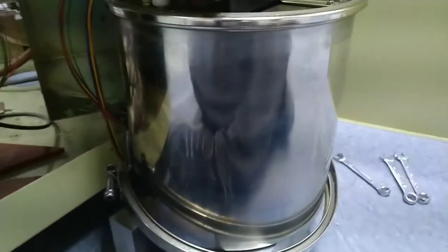By the weight of it, there's a very sizable coil in there, so I am going to try and reuse all that stuff. As far as I can tell, the circuit board looks okay — not any major burn marks. So I might be able to fire it up, hopefully without too much fire.